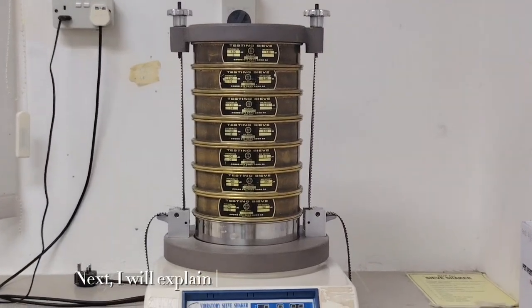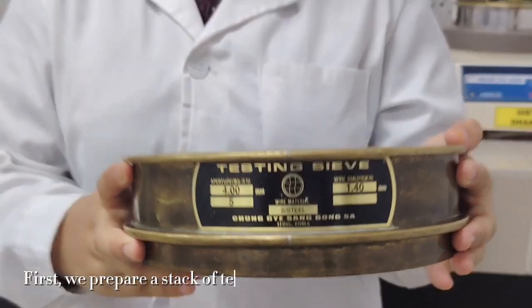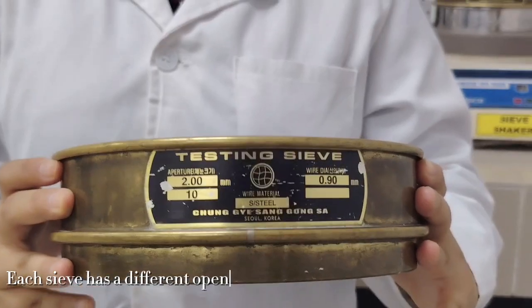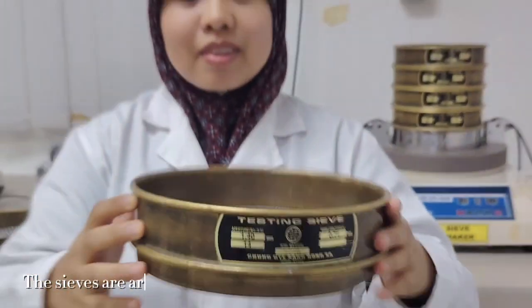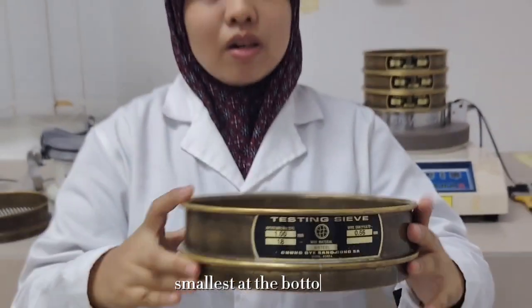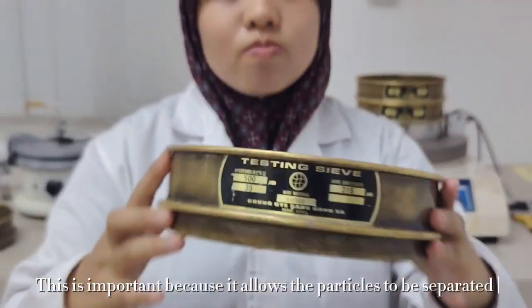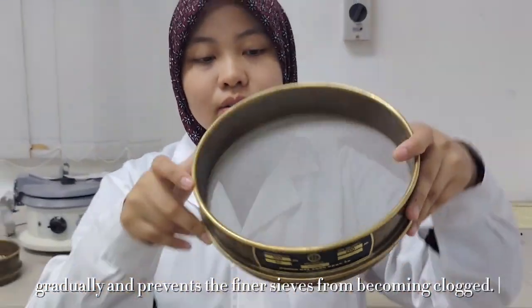Next, I will explain the operation of the sieve shaker. First, we prepare a stack of testing sieves with different mesh sizes. Each sieve has a different opening to separate particles according to their size. The sieves are arranged from the largest opening at the top to the smallest at the bottom. This is important because it allows the particles to be separated gradually and prevents the finest sieves from becoming clogged.